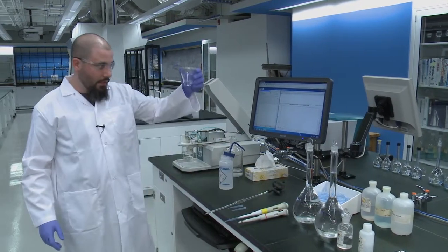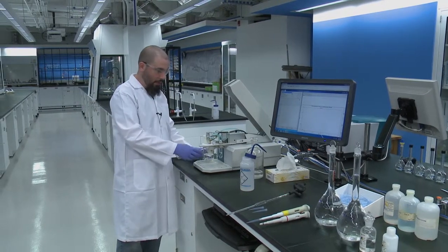Once you have your cell built, you'll want to place it back into the instrument.